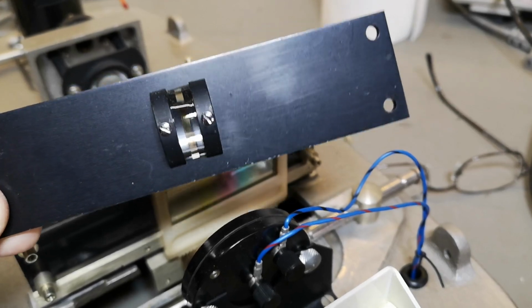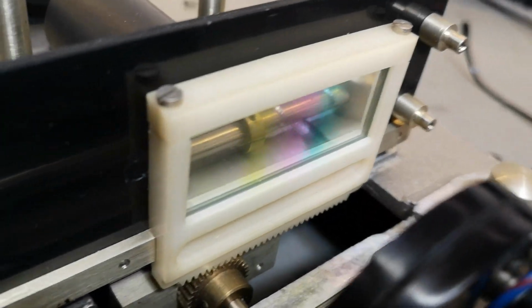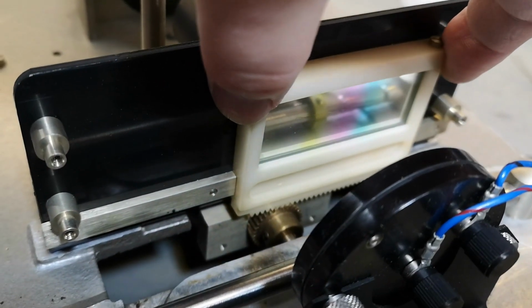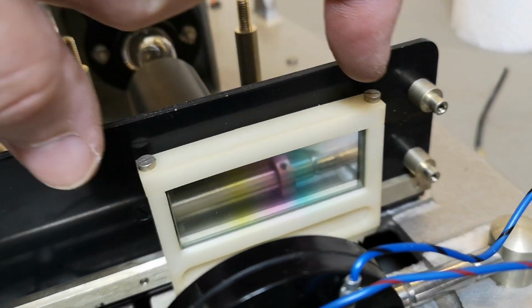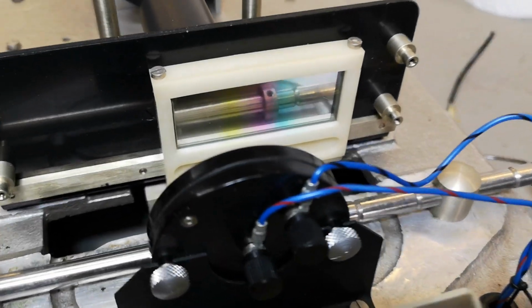I wanted to see exactly what is going on here, so I took away this part. This is the color filter, and I believe this unit should be able to... No, this is kind of stuck. I did of course leave two tiny little marks on each side here, so I can put this back at the exact correct spot. And then I put this for 400, so I know exactly where to put it.